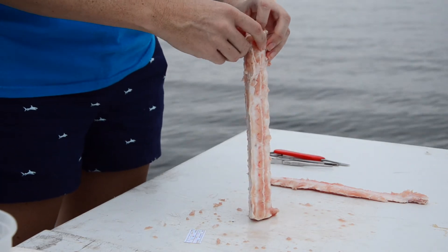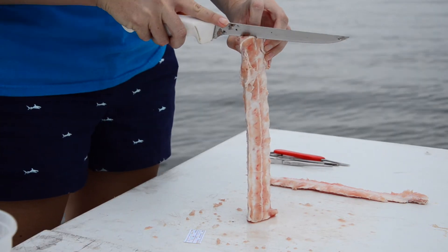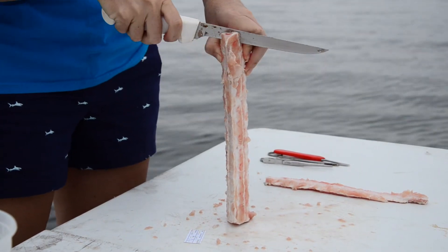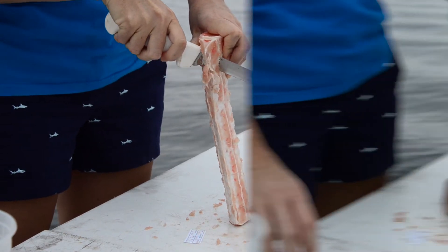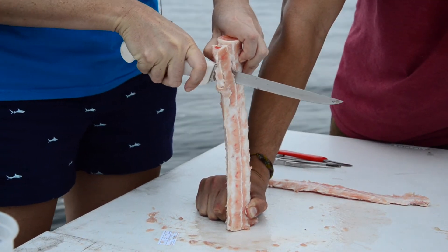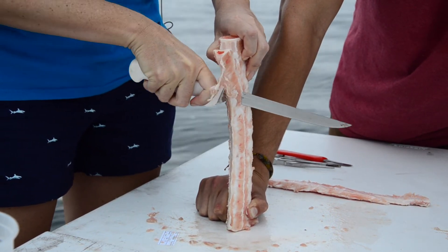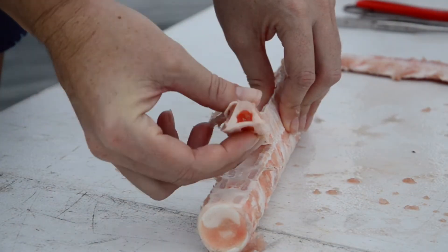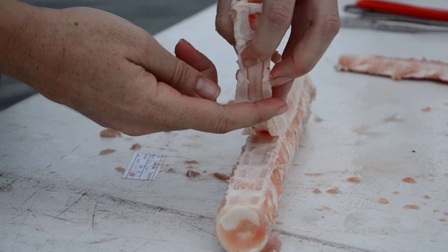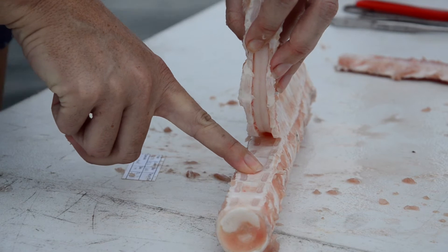I'm going to start from the top. It's very important that you watch your fingers, so I keep mine back from the knife's blade and start to cut down. Because this is such a large log it's a little bit unwieldy, and I've got a volunteer who is bravely holding the bottom so it doesn't slip. I'm using small strokes and it should encounter very little resistance. Getting close to the vertebra is the easiest way to make the cut.